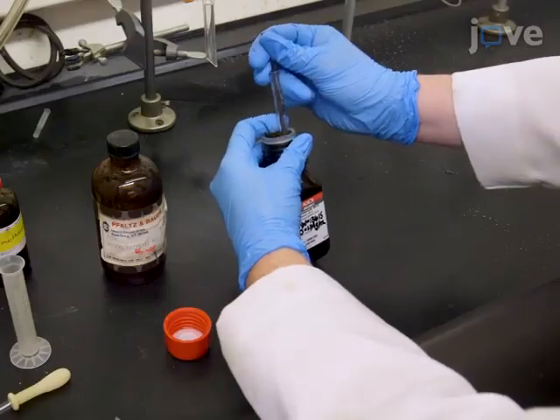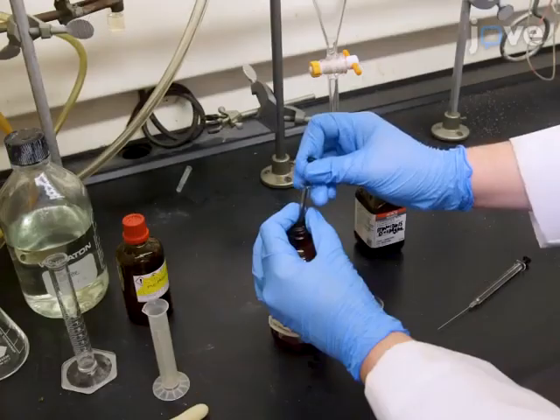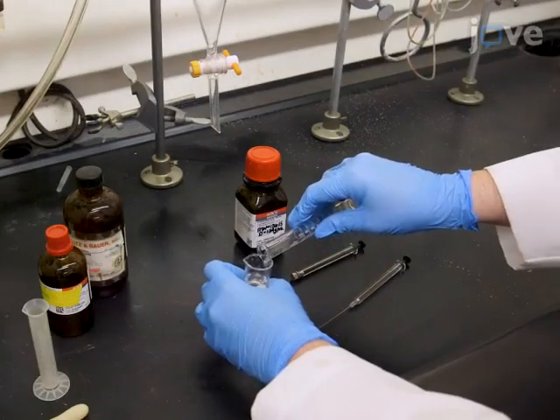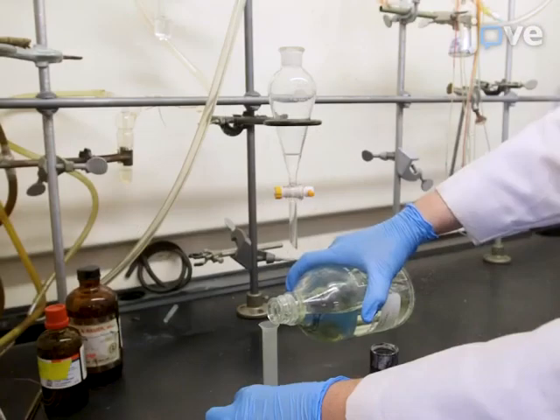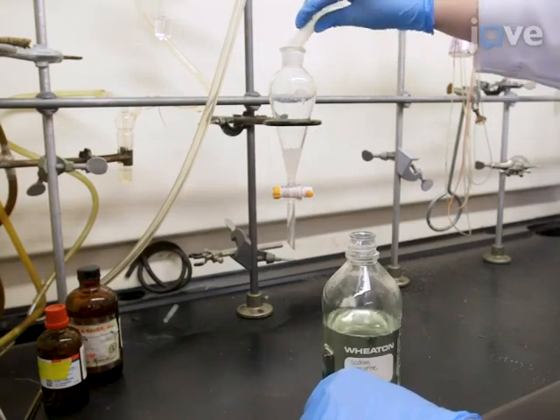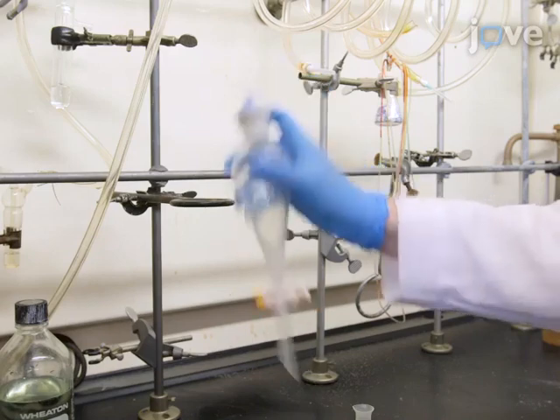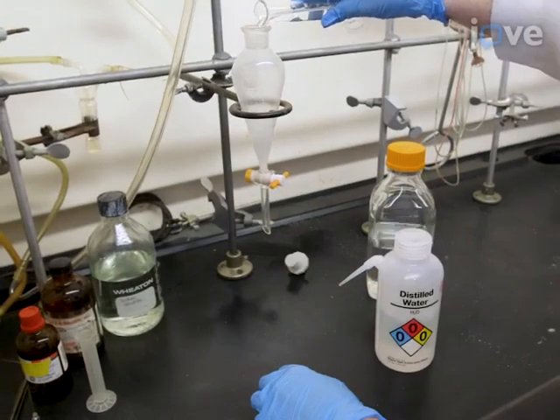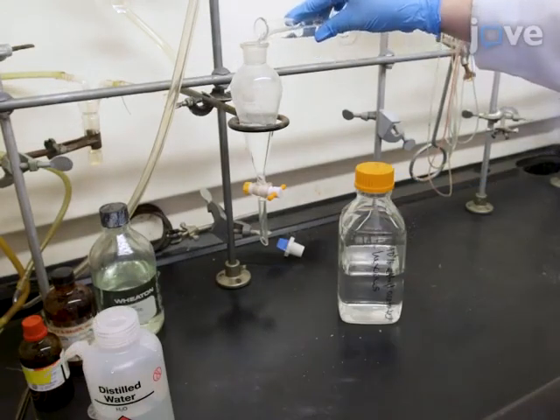To begin, dissolve 175 microliters of anisaldehyde and 250 microliters of benzylbutyrate in 5 milliliters of methanol. Transfer the solution to a separatory funnel. Add 1 milliliter of saturated aqueous sodium bisulfite and shake vigorously for approximately 30 seconds. Then, add 25 milliliters of deionized water and 25 milliliters of 10% ethyl acetate hexanes and shake vigorously.